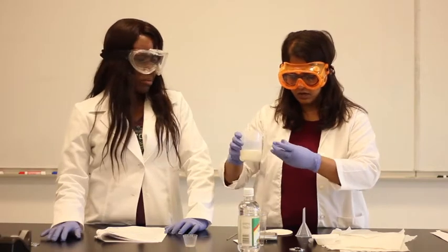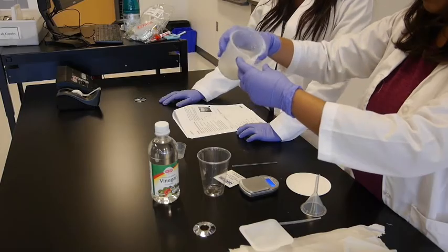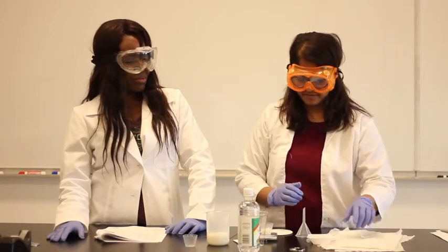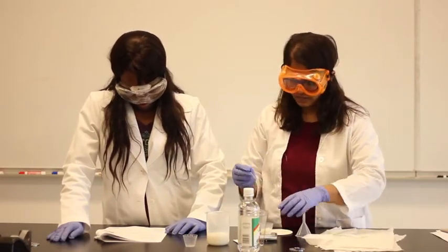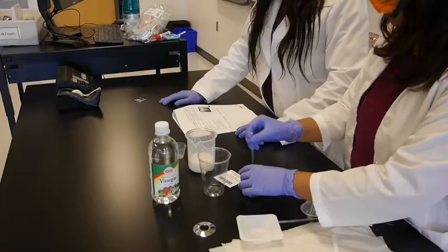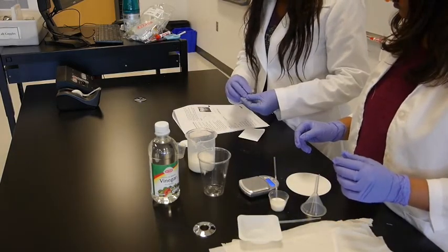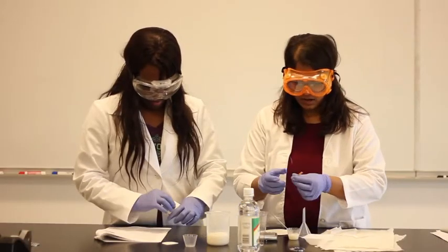So let me take 10 ml right from here. The medicine cup is graduated. Graduation means it has marks for you to read the volume. It doesn't mean that it graduated from a program. Then we have this right here, and let's see the pH of this suspension. We have the pH paper right here. Let's touch the pH paper like this and see the change in the pH paper.